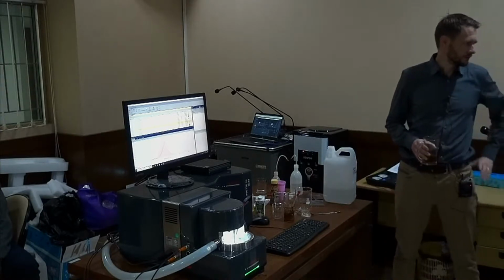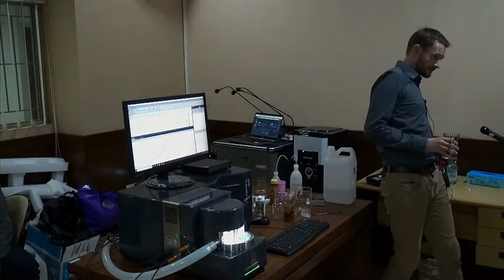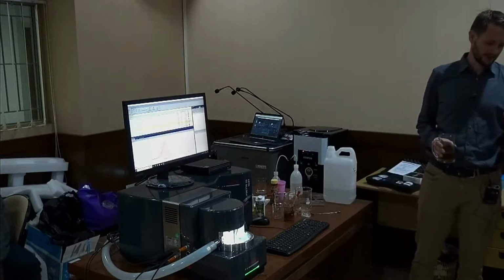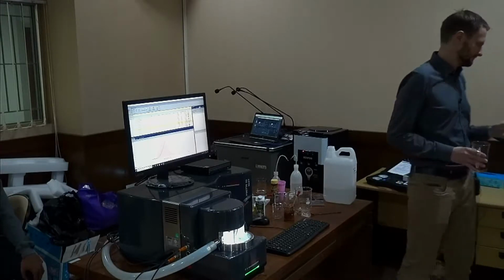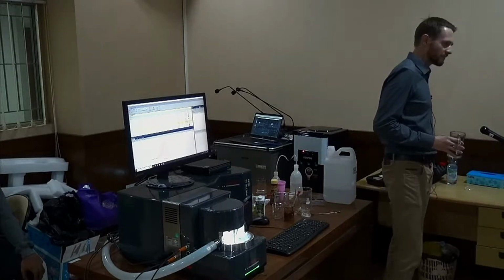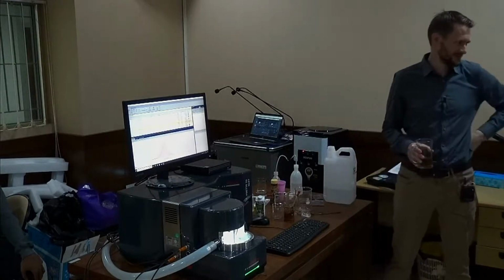So, the material. You mean your carbon or this surfactant? Well, I said 1 drop on 20 ml, and you can use just a couple of drops for each dispersion. This will last very long. Trust me, very long. Okay, thank you. If you manage to finish this within 5 years, I'm surprised. You used way too much.